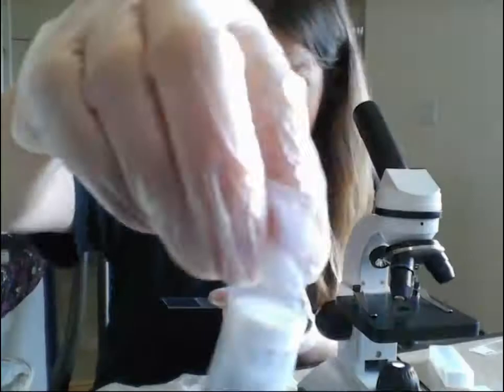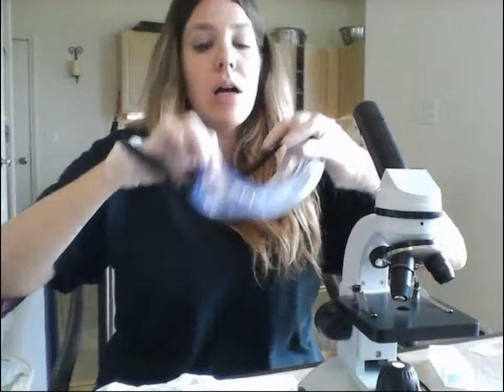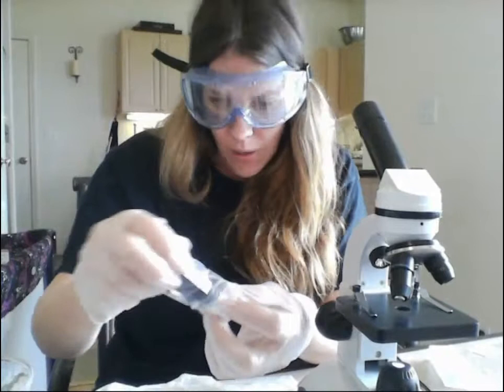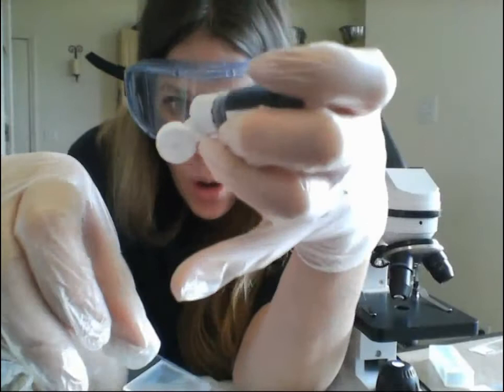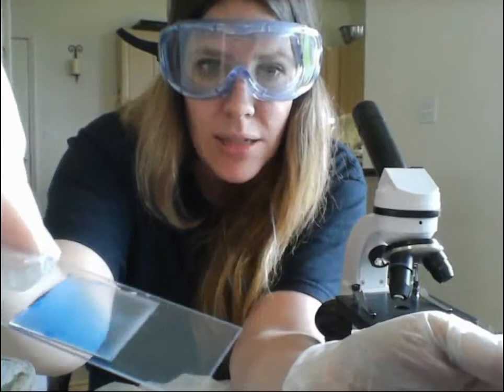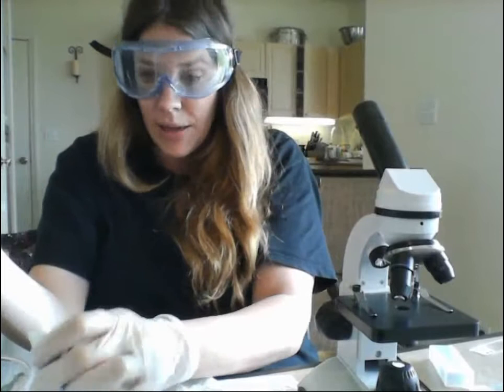Now find your methylene blue stain. This stuff stains, so you should be wearing your lab coat, goggles, and gloves — you don't want this getting in your eyes or on your clothes. Very carefully, pour one drop right on the edge of the cover slip, then hold the slide at a 45-degree angle and you can see that stain being pulled under the cover slip. This stain likes to stain the nucleus of the cell. Once that's done, you can take off your goggles.